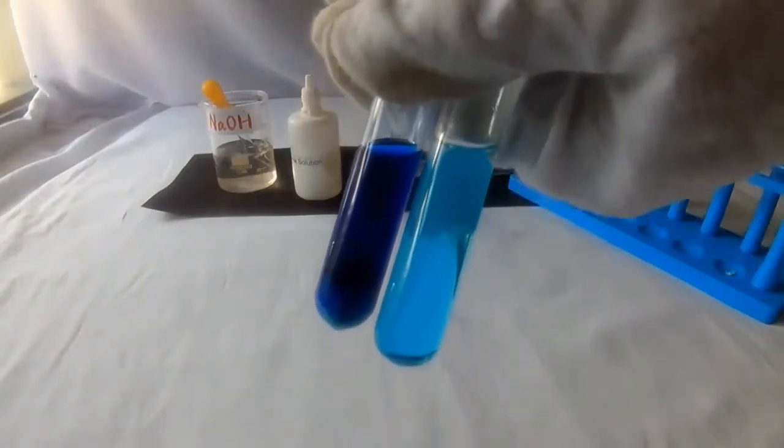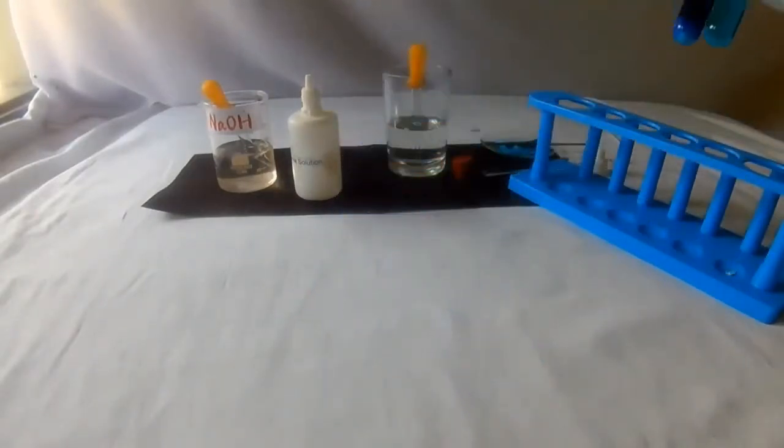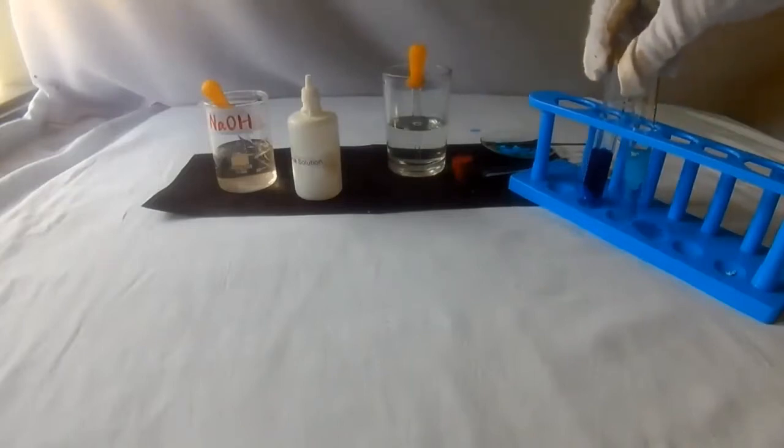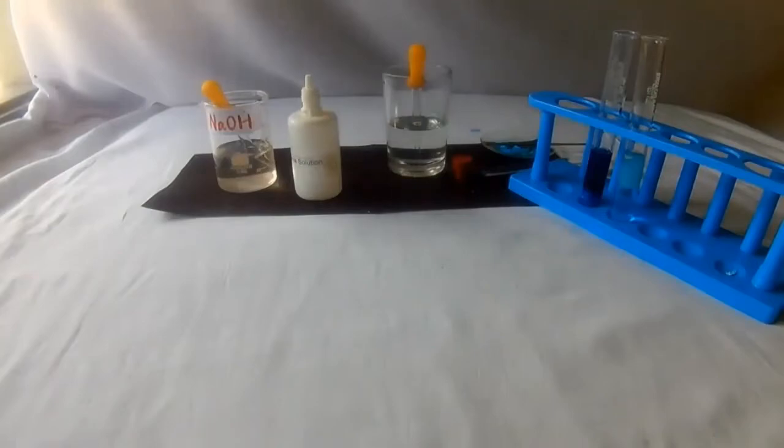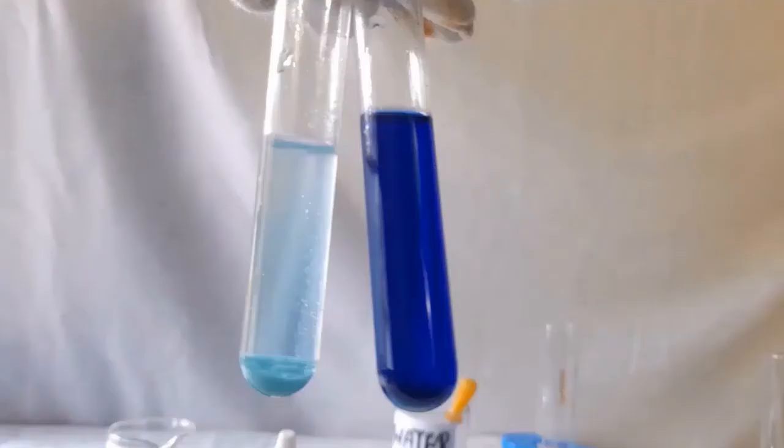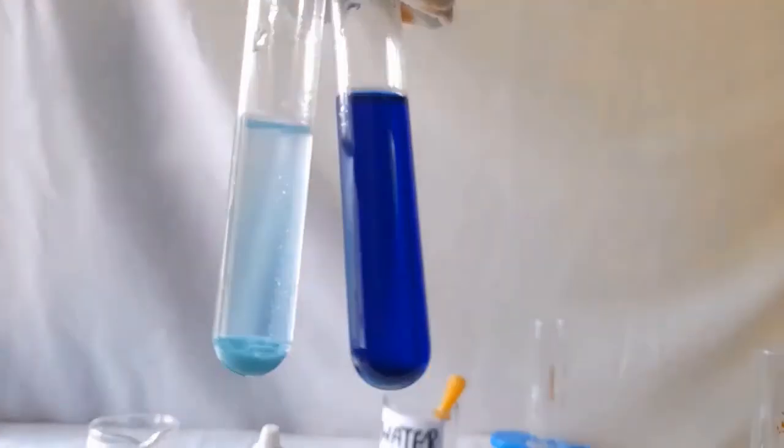It dissolves to form a dark blue solution, forms a pale blue precipitate with excess sodium hydroxide, and deep blue solution with excess ammonium hydroxide. Observe. Compare. Let us understand.